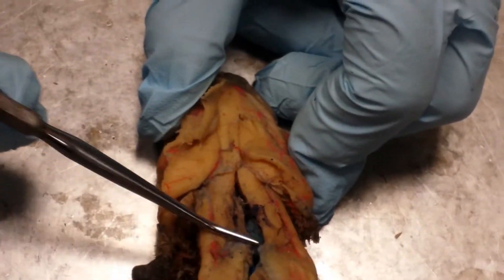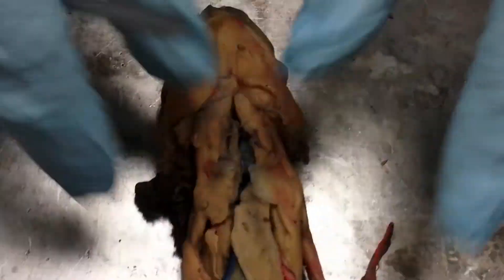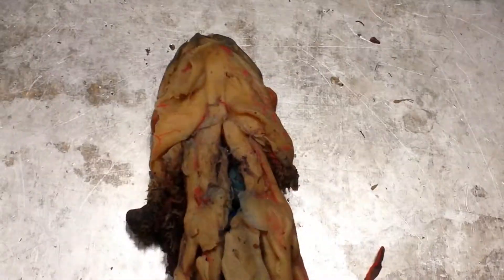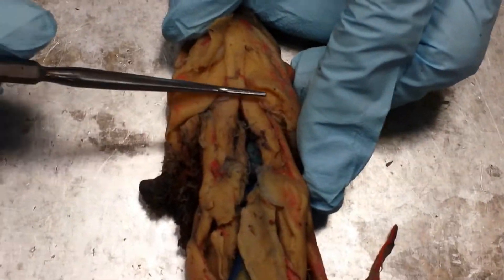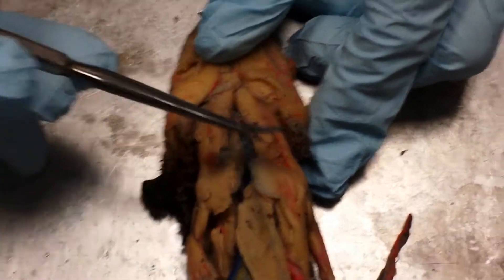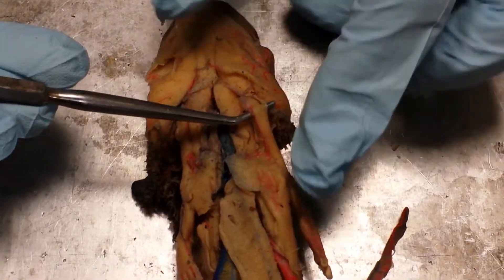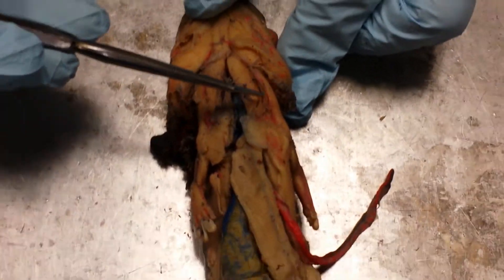If you look on the neck part of the salamander, you'll see that its muscles are running like the heads of arrows — they look like chevrons. Those are called the rectus cervicis muscles.